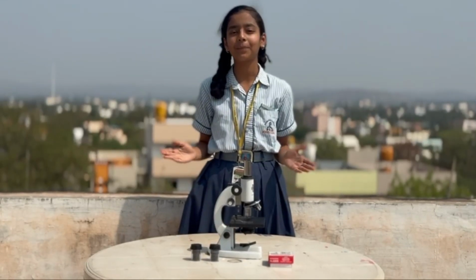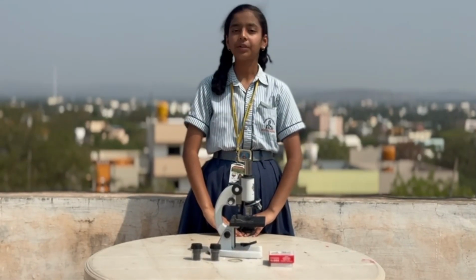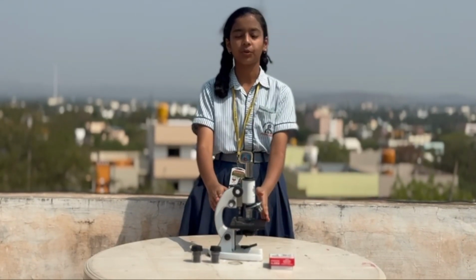Everyone, myself Vaishnav from 9th standard. I'm from Nivedita school. Today I'm going to explain about the microscope.